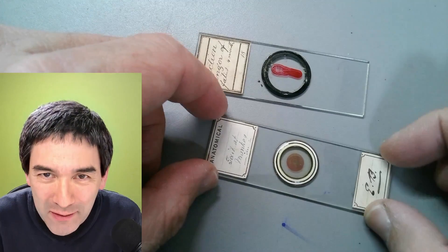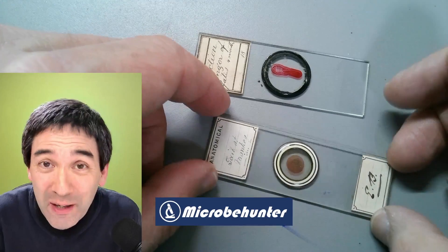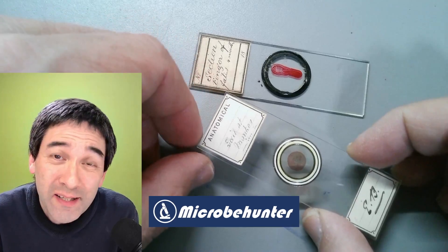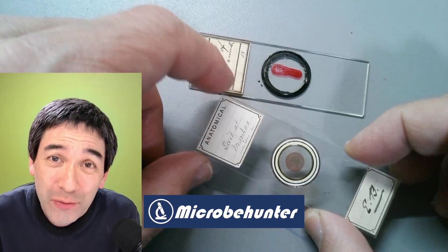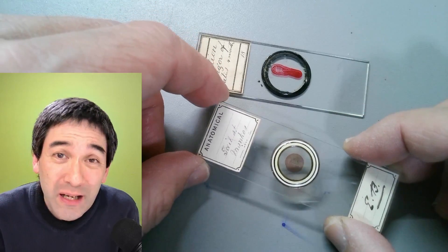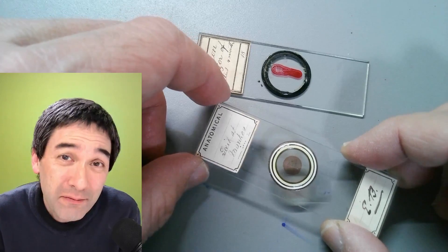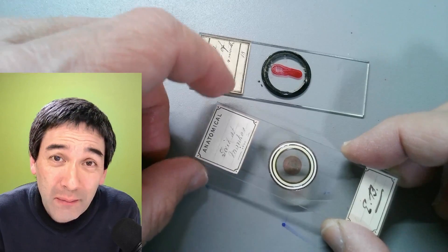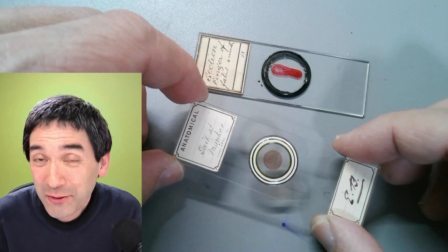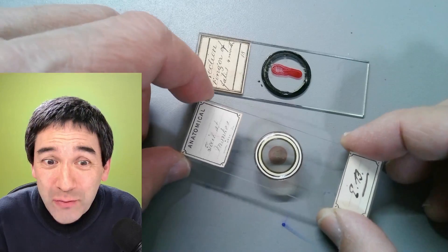Hello and welcome again. Microbe Hunter here, Oliver here. Today I would like to show you these two microscope slides, and some of you might consider them to be a little bit controversial. However, they are my favorite microscope slides. I already made a video showcasing these slides several months ago, and I did not get many views — some people even unsubscribed from the channel.